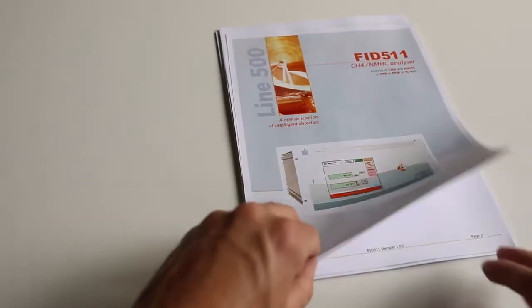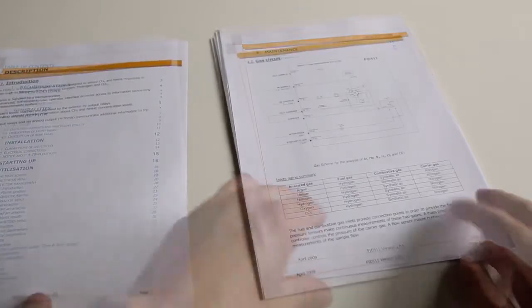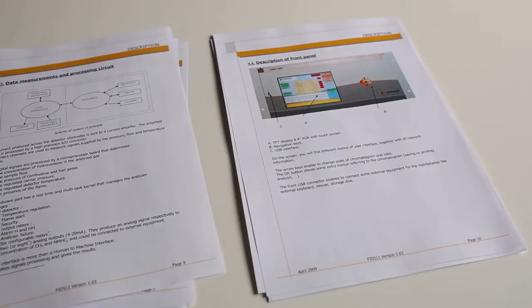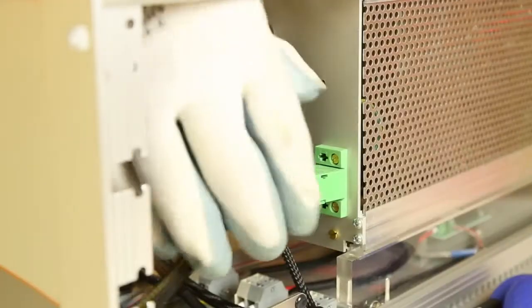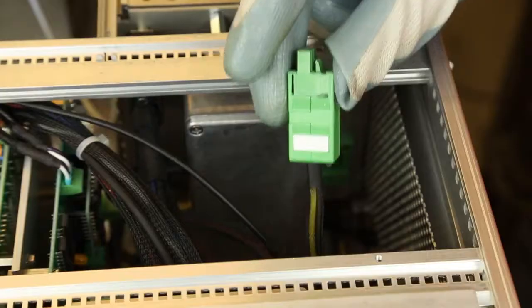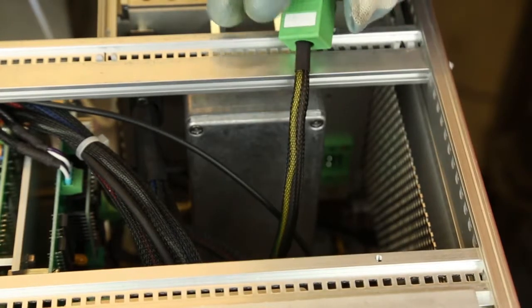With the help of the documentation provided with the analyzer, check the working and regeneration temperatures of your detector. After removing the upper cover of the module, disconnect the gas box power supply using insulated gloves.